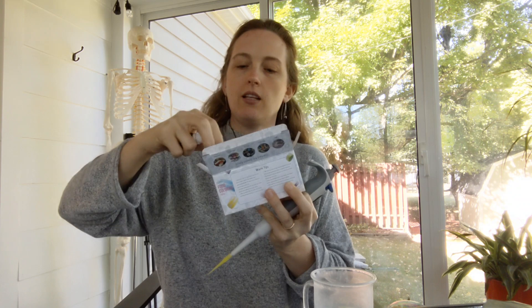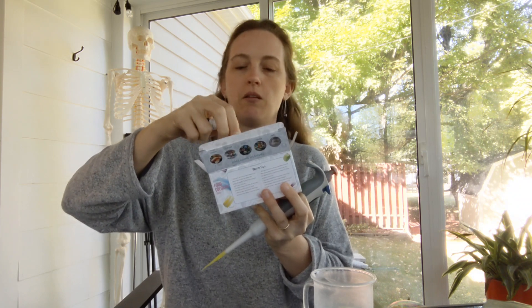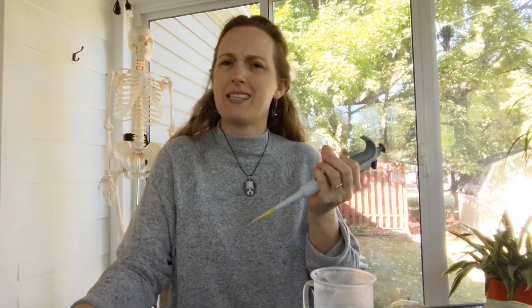The purpose is you're going to make a mystery solution using water, your micropipetter, and then a dye of your choice. So what I would suggest doing is just picking out any dye. Food dyes work really well. Maybe pick one that you like the color of or that you have a decent bit of. Let's do red, why not. For some reason I do blue for this a lot, but I don't really know why that is. So any dye will work. What's important is that you have enough of the dye remaining that the students can use the same dye you used, and you don't need to give them very much. 500 microliters is more than enough for each group, and so with this amount I could do this lab 10 years in a row and it would be plenty.